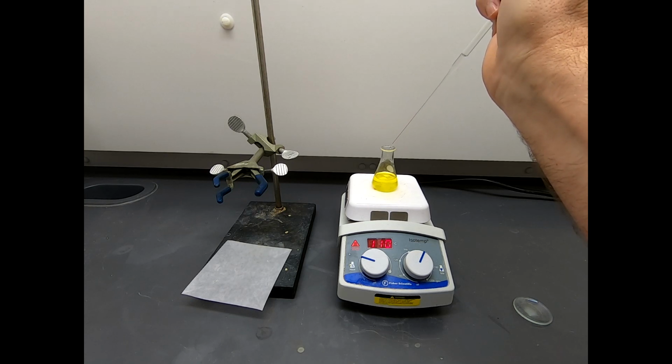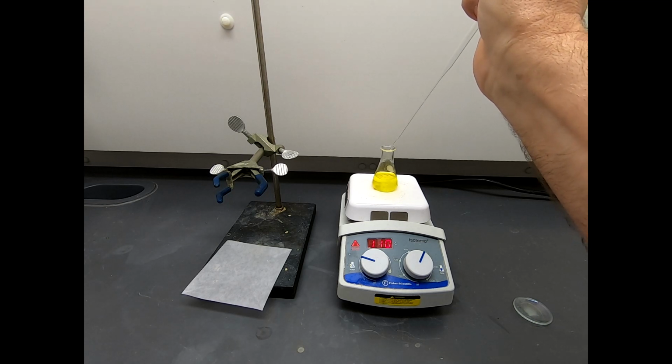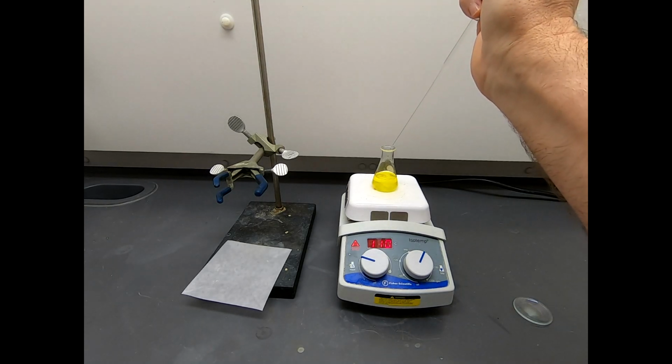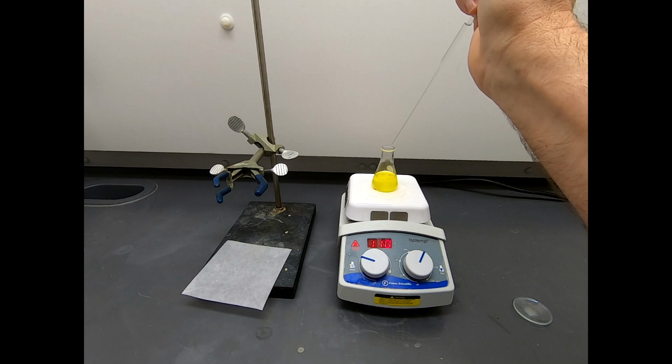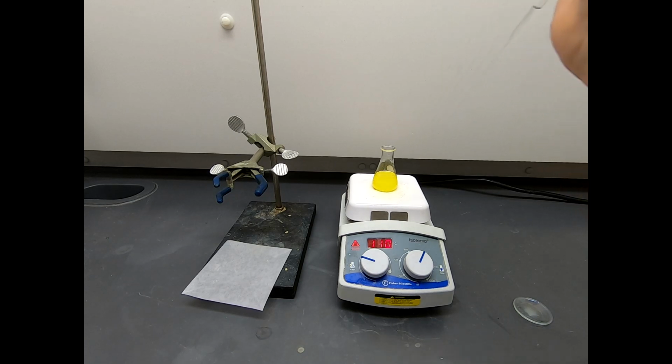Okay. I'm trying to add slowly because I want to add slowly, but if this is going to take a lot, I don't want to go too slowly. Okay, that's about 2 milliliters of water. Keep adding until it gets cloudy. That cloudiness is more and more persistent. It's almost a titration. We're kind of titrating the solubility. Boom. Oh, okay. Well, that's cloud point, and that's solid. Okay, bam. So that's far enough.